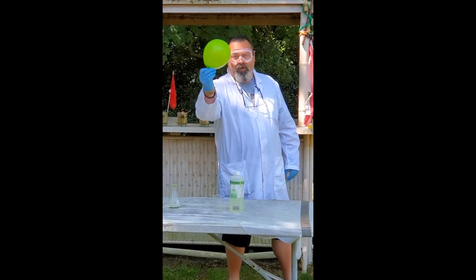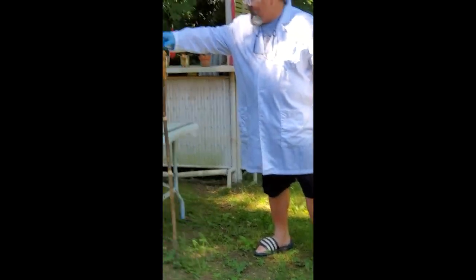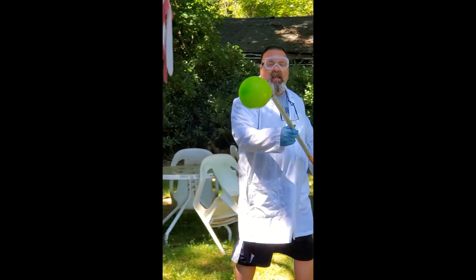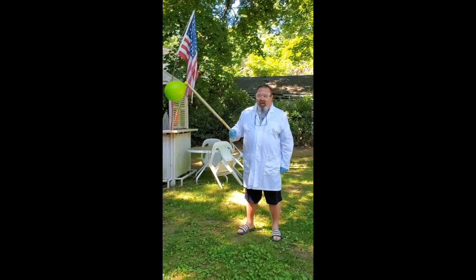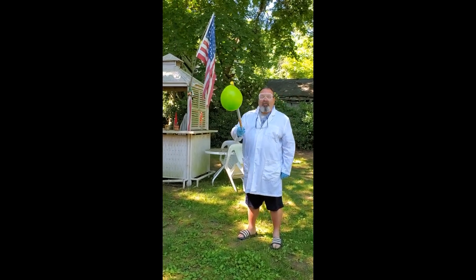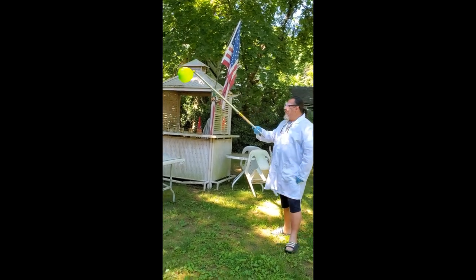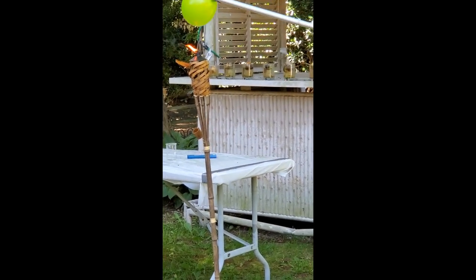Alright, now we're going to go ahead and do that. Using a VLL — very large lighter, haha — we're gonna go ahead and... okay. This was the balloon that I captured the gas from the chemical reaction between zinc and hydrochloric acid. A gas was released and captured in the balloon. My chemistry — 2020 — going out with a bang.